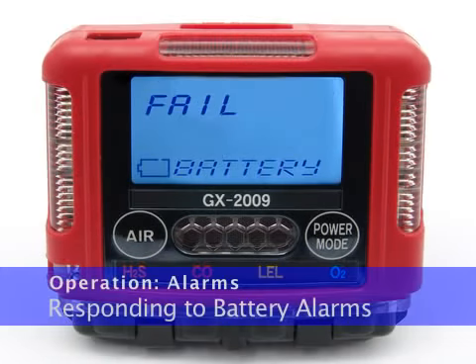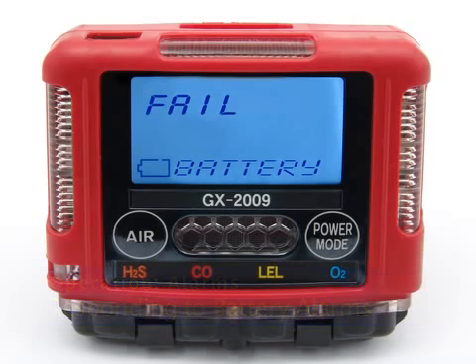The GX2009 is not operational as a gas monitoring device during a dead battery alarm. Take the GX2009 to a non-hazardous area. The GX2009 is fully functional during a low battery warning. However, the GX2009 has only 2 or 3 hours of operating time left after the low battery warning has been triggered.